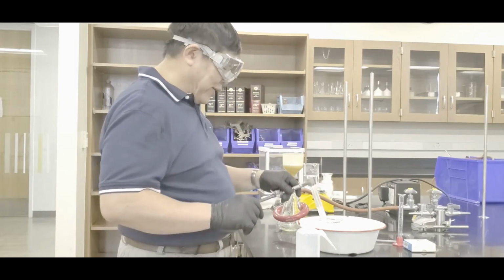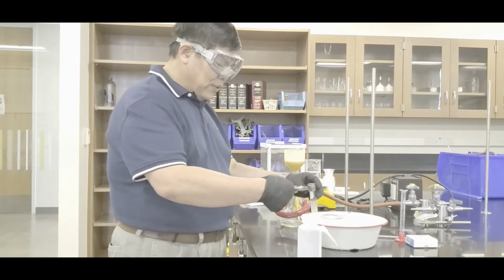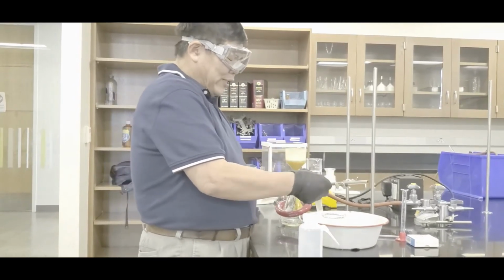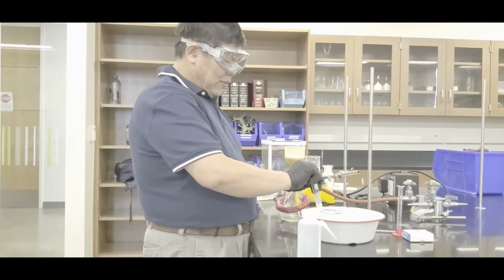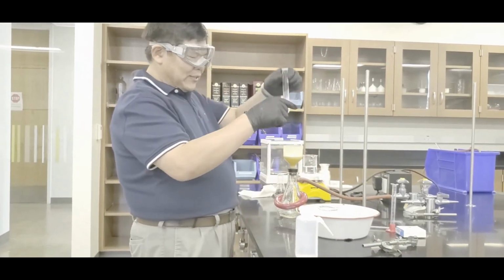Oh, it's kind of foggy. So in that case, what you want to do is this. It's still on. Separate the test tube from the clamp, okay? Loosen it up and go like that, okay? Now what you want to do is this.